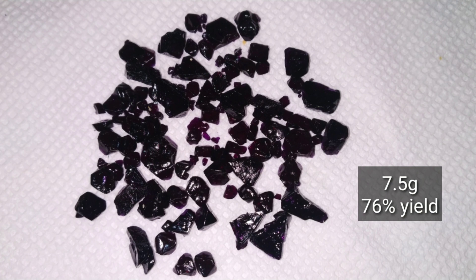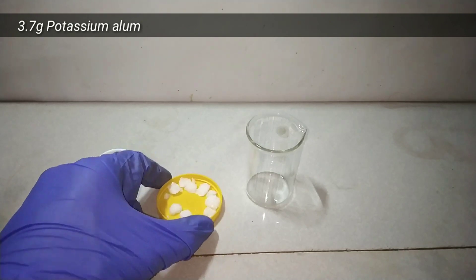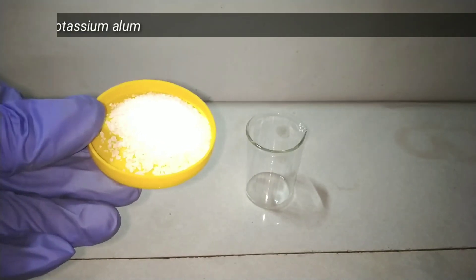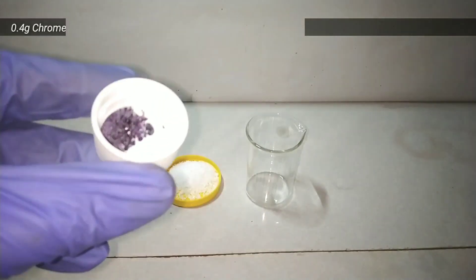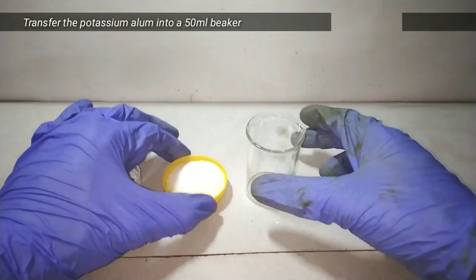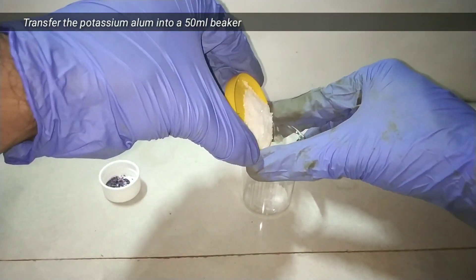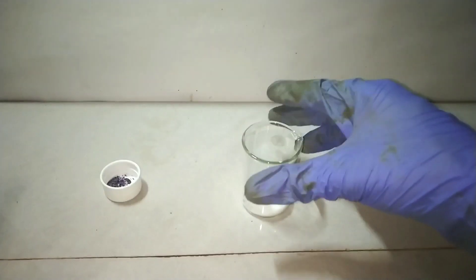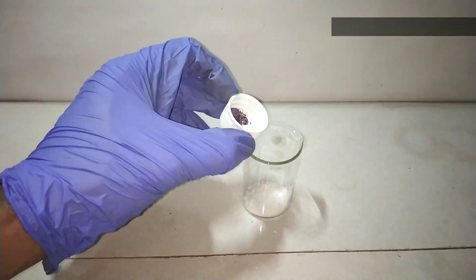This is the final product, the chrome alum, which I will be storing. I also made an attempt at making a large crystal using a combination of potassium alum and chrome alum. I took 3.7 grams of potassium alum, which I prepared in a previous video, and pulverized it. I also took 0.4 grams of the chrome alum we just prepared, then transferred both into a 50 ml beaker.